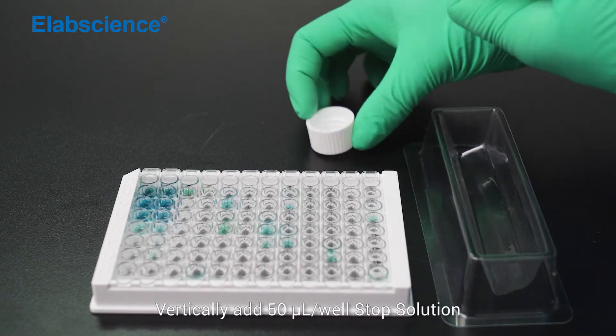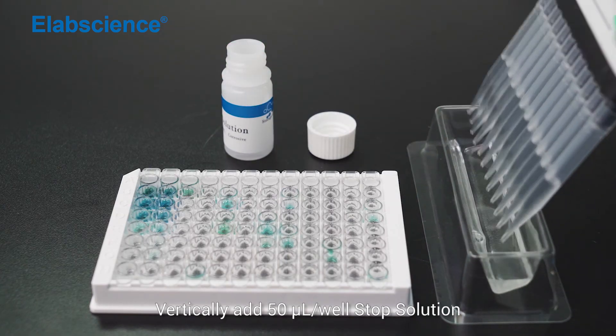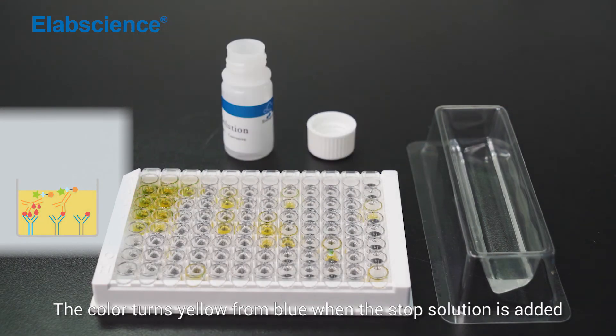Reaction terminated. Vertically add 50 µL per well stop solution. The color turns yellow from blue when the stop solution is added.